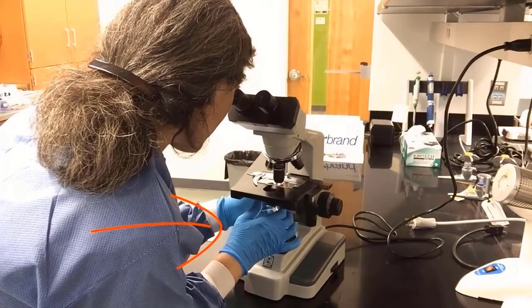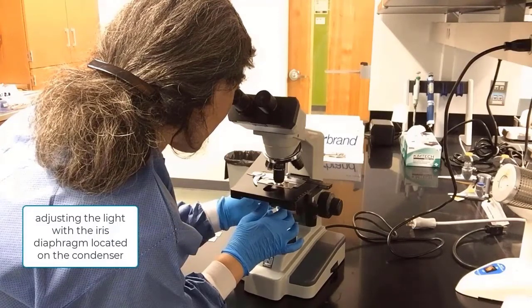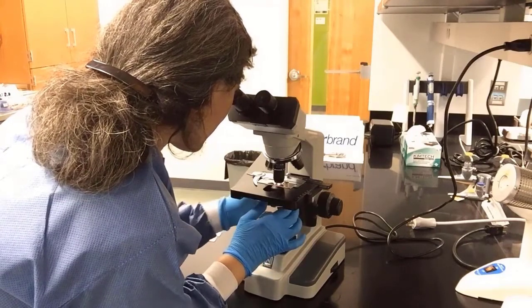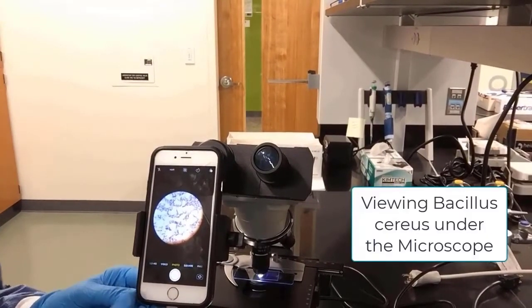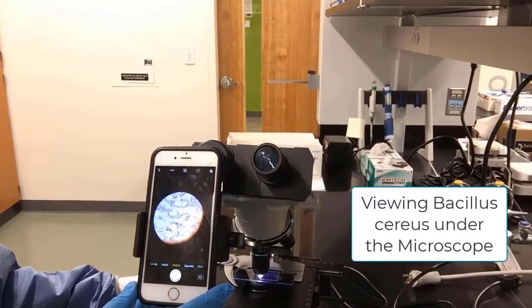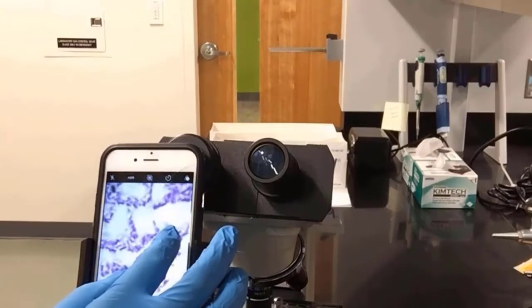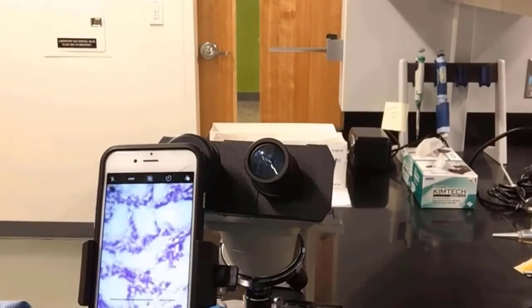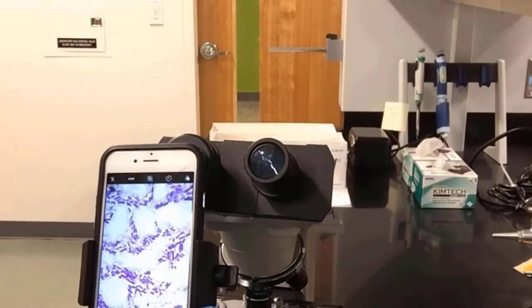Notice here I am adjusting the light using the iris diaphragm located on the condenser just to get a better, more clear, crisp view of the bacterial cells. This is an iPhone that is connected to a device that can go through the ocular piece, and it's showing you here Bacillus cereus under the microscope, 100x immersion oil, and I'll make that a little bigger and you can actually see the bacilli. And they are purple because we stained them with crystal violet.